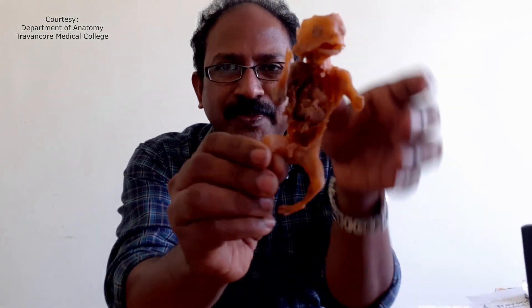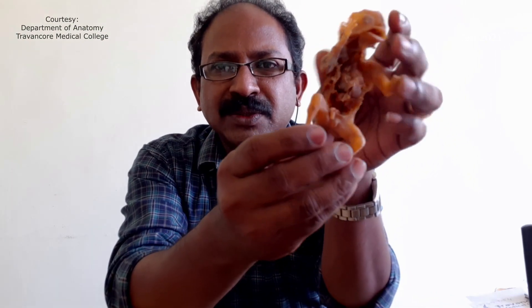That time I was looking for a cheaper alternative and this is the result of that. This was done with polyester resin — polyester resin and fiberglass resin are the same. Some parts of the limbs have broken off, it is not flexible, and the color has changed very drastically. This specimen has become translucent.